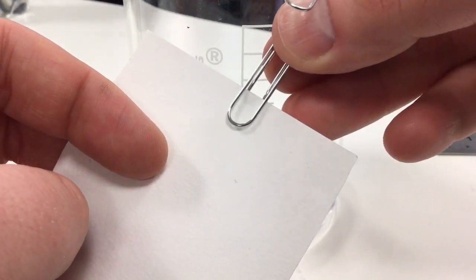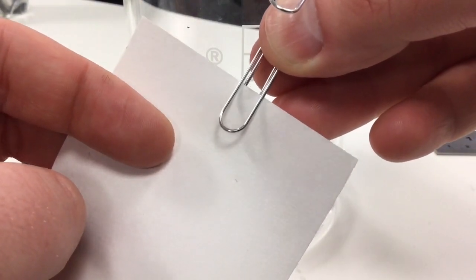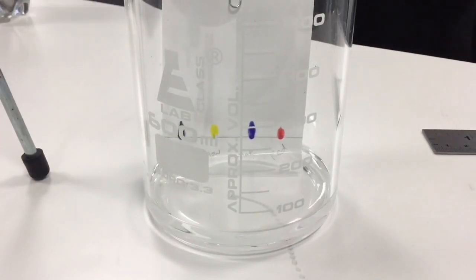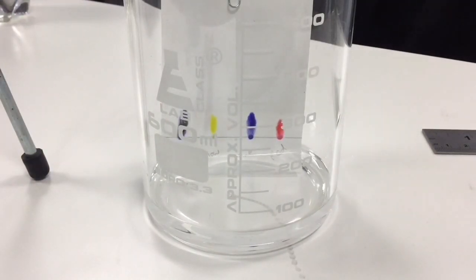To prevent the chromatography paper falling over during chromatography analysis we can place a paperclip at the top of the piece of chromatography paper and use this to hook to the top of the beaker during chromatography.